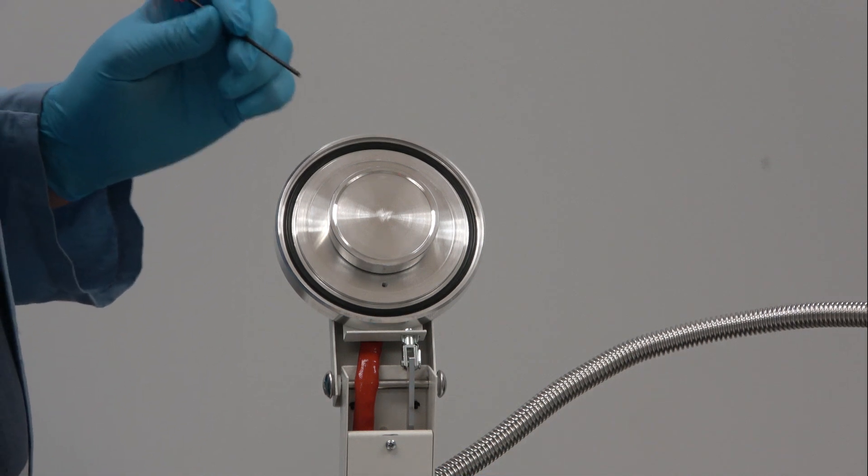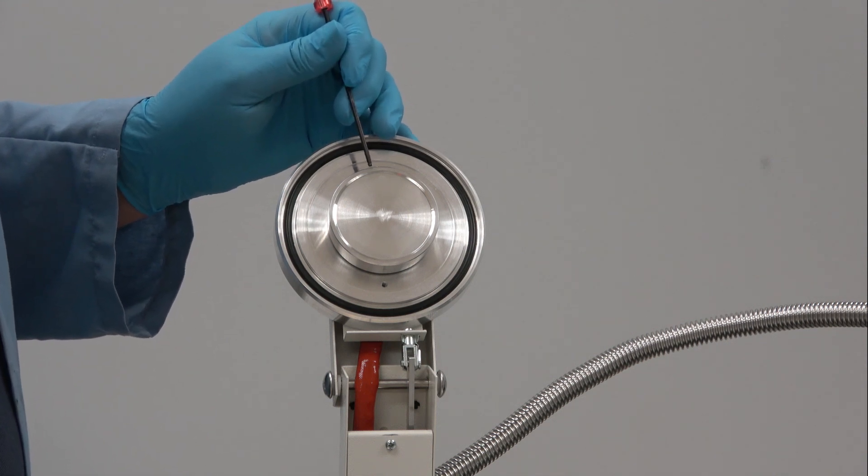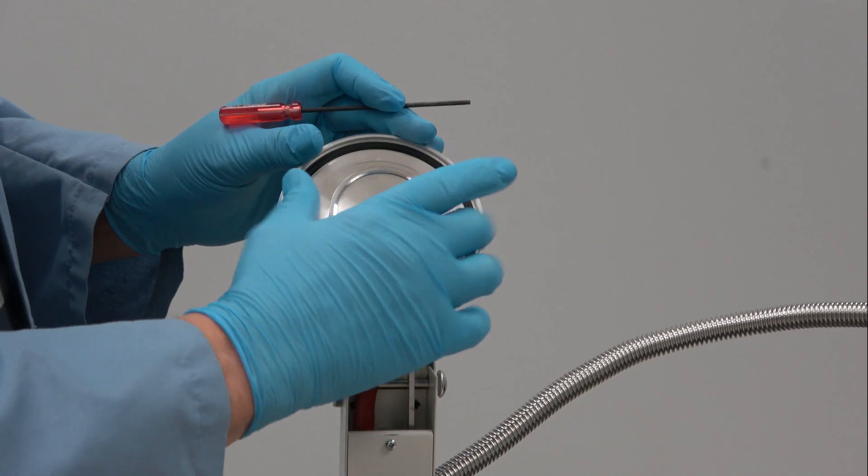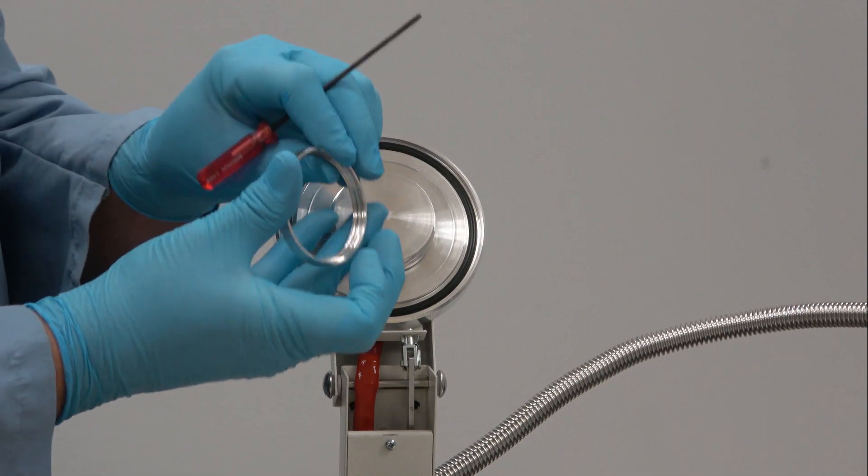This is the tricky part. And for some reason in the instructions it's not clear. There is a screw on retaining ring which needs to be unscrewed and loosened.